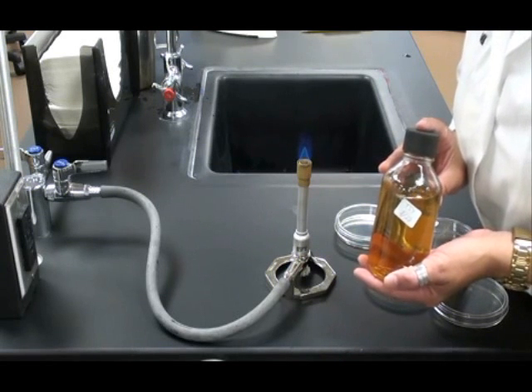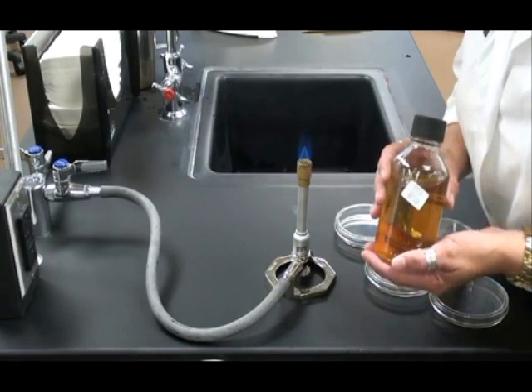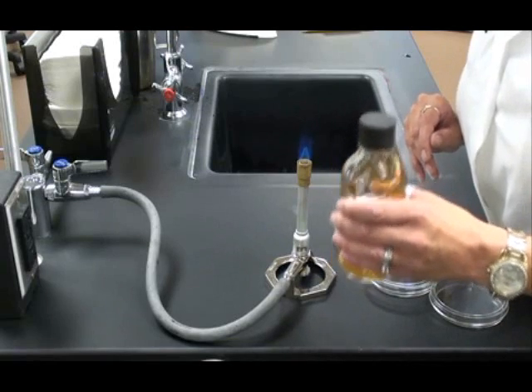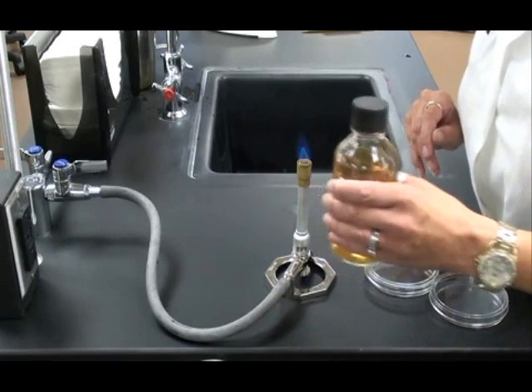Once I've retrieved my TSA from the warming oven, I need to gently mix it up. I'm going to swirl the bottle just a little bit. I don't want to shake it or create any bubbles.